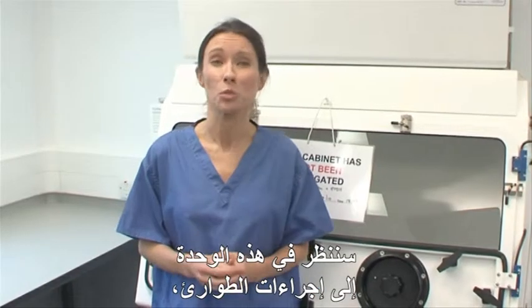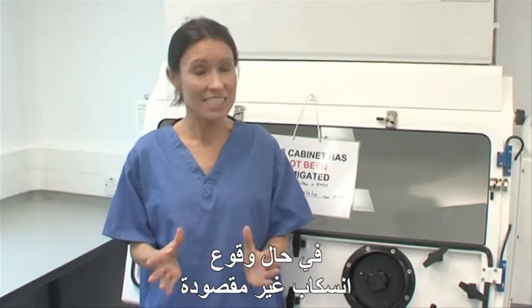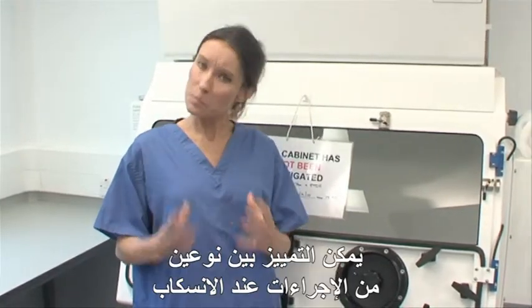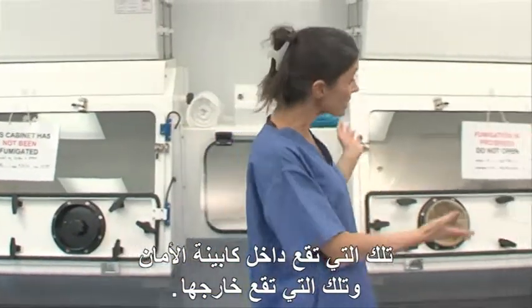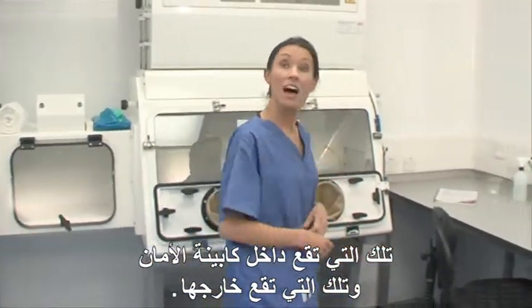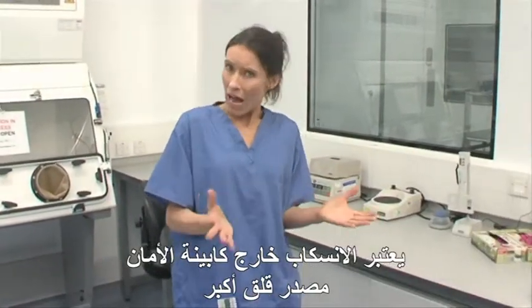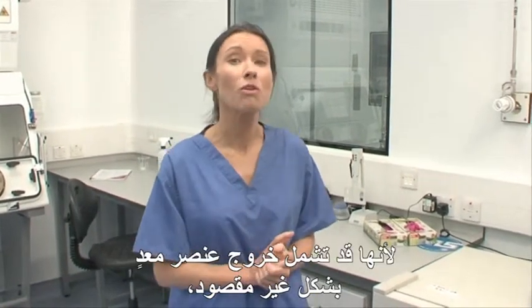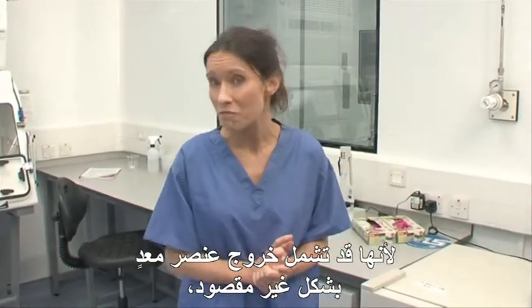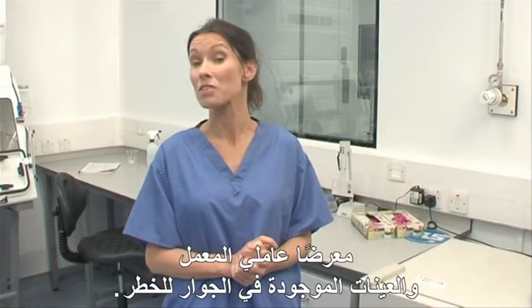In this module, we'll be looking at the contingency procedures in the event of accidental spills. Spill procedures can be separated into two, those inside a safety cabinet and those outside a cabinet. A spill outside a safety cabinet is of greater concern as it could involve the accidental release of an infectious agent, putting laboratory personnel and samples within the vicinity at risk.